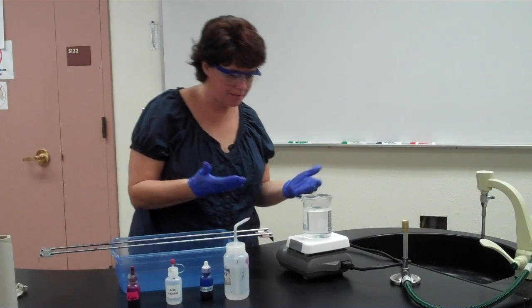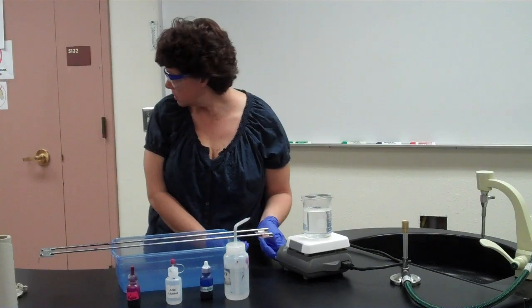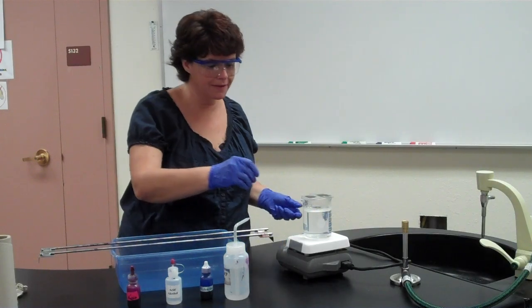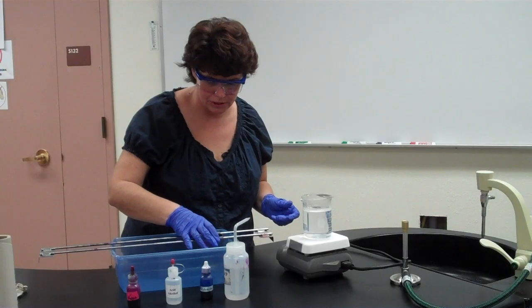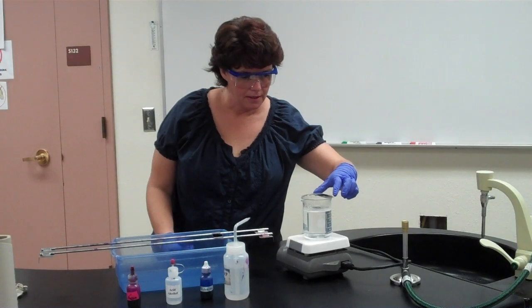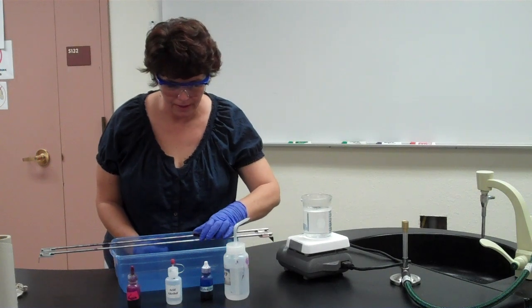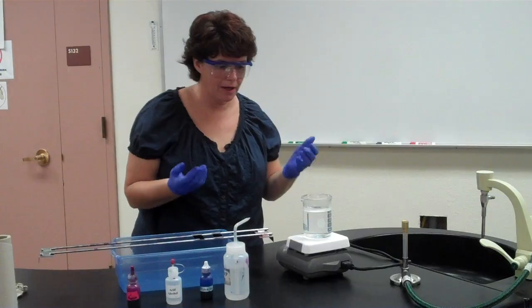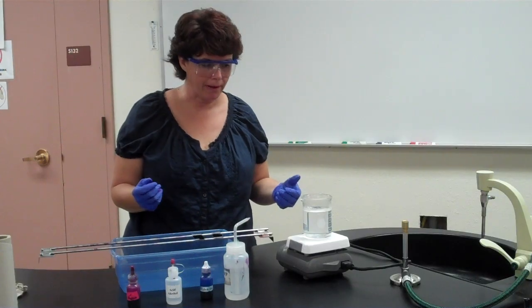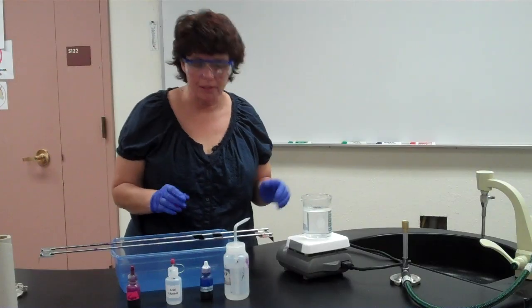So that has been steaming for 5 minutes. So what we want to do is gently remove the slides. Now this is hot, but it's not so hot that I can't touch the edges of it. You want to be careful not to get too much of the dye in the water. You notice I didn't burn myself. It's not extremely hot because I don't have this rapid boil going, okay? So don't be too afraid of it, you're probably not going to burn yourself.